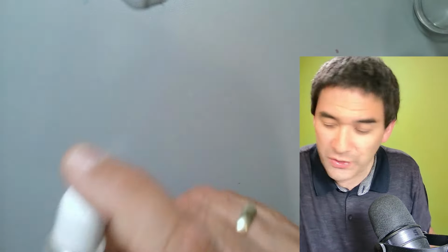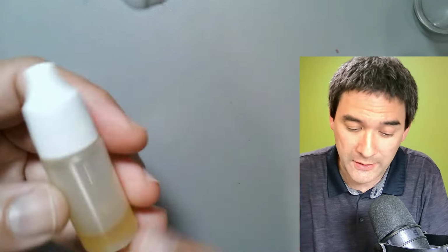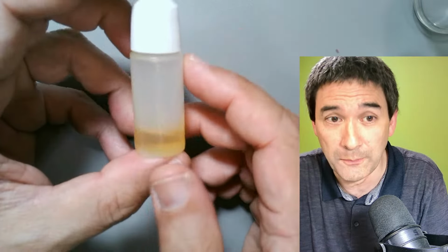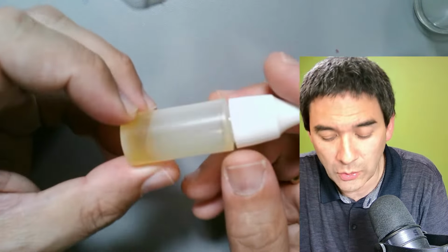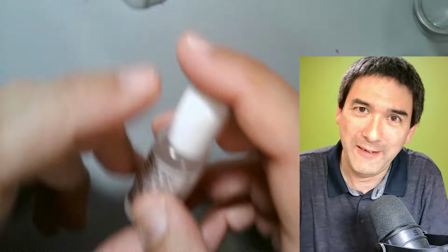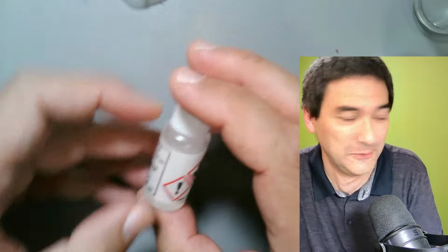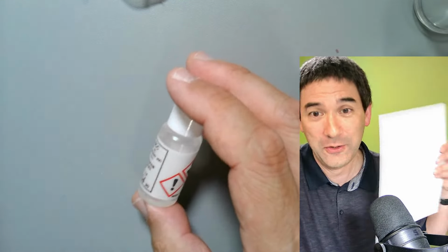I also want to show you something else that I consider a little bit remarkable. When you buy those microscopes with oil immersion objectives, they frequently come with those bottles here, and you don't really know what's in it. I don't know which refractive index it has. I don't know what substance it is. If you buy oil from a known company, look what you're going to get along with the bottle. I just want to show this to you, okay? You're getting a full manual just for the oil.